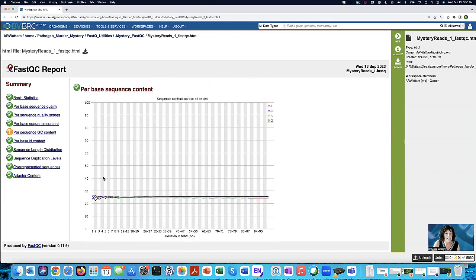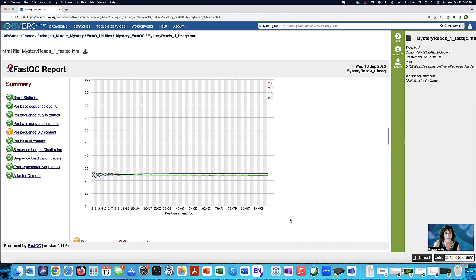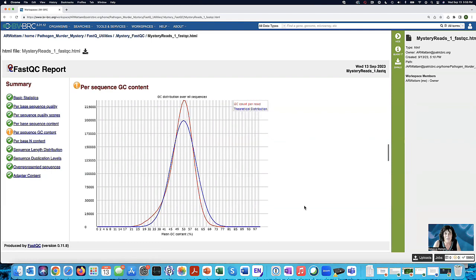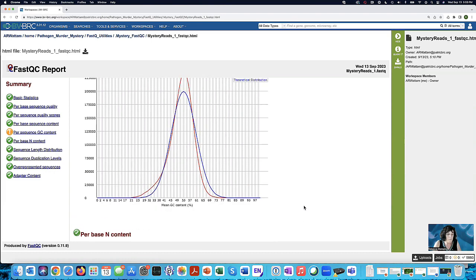The sequence content, sometimes this has a lot of noise going in, but this is nice and tight. And this is the one where they have it. The theoretical distribution is blue, and the red ekes out of that just barely here. So that's a little bit concerning, but I'm not going to be concerned about it. I don't even need to look any farther because I'm going with this data, but you're new to this, so we'll go all the way, and I'm doing it just for you.